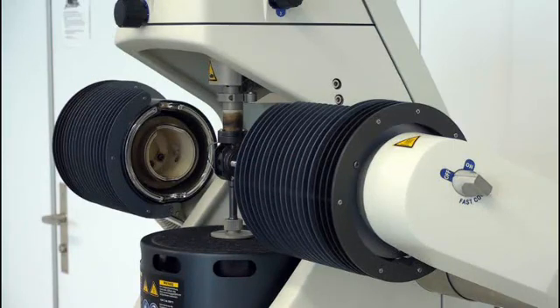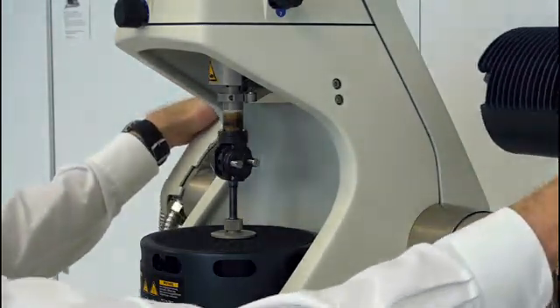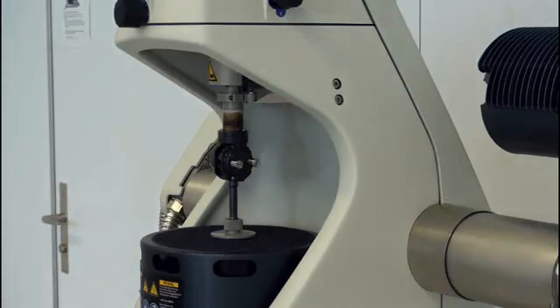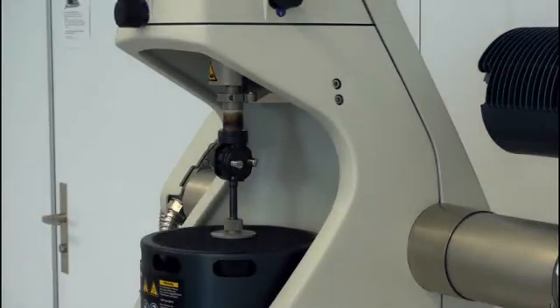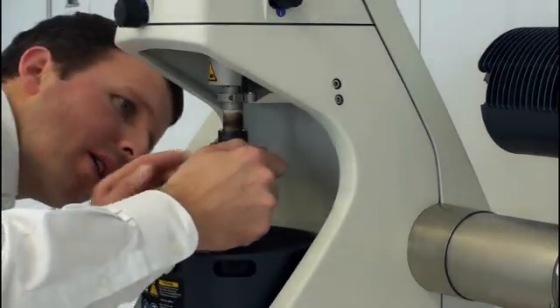Let me show you this. Once the furnace is open, I can swing both arms to the back. Now I have even more space and I can work on my clamping assembly without any furnace part disturbing me. This is unique. This furnace design not only allows me to easily access the clamping assembly, it even allows me to visually check the installation if everything is okay after I mounted the clamps.